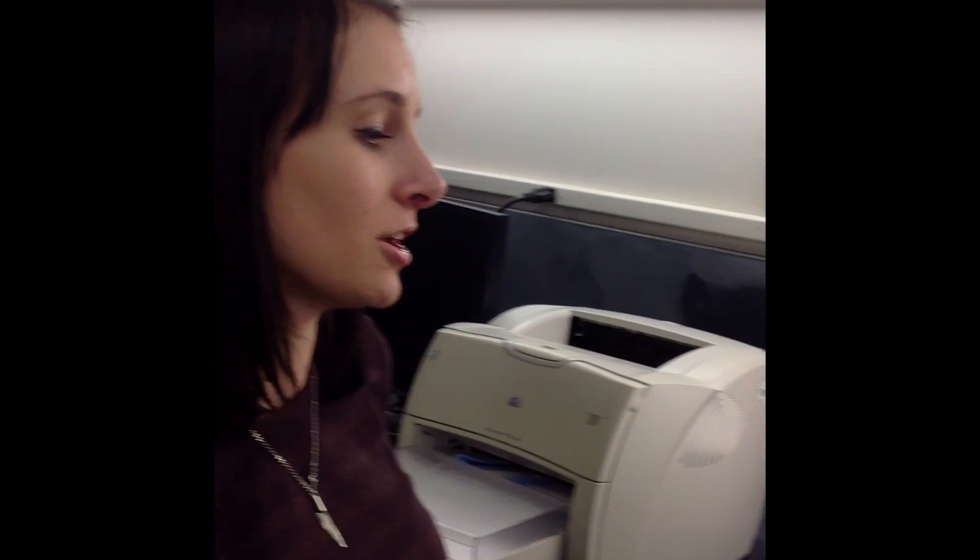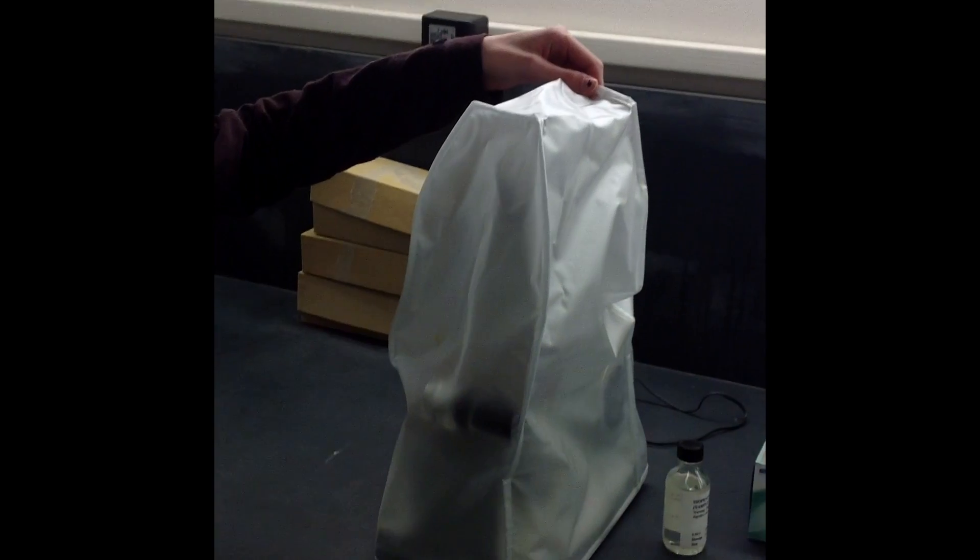Hi, I'm Misty and I go to Shoreline Community College. I'm going to show you how to use the refractometer so you can take a refractive index reading.